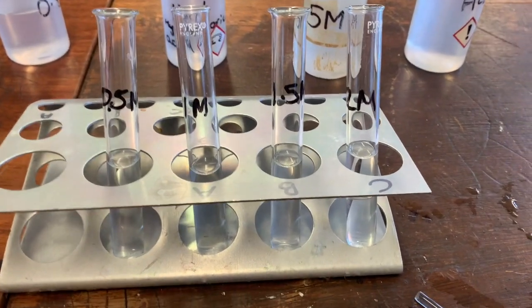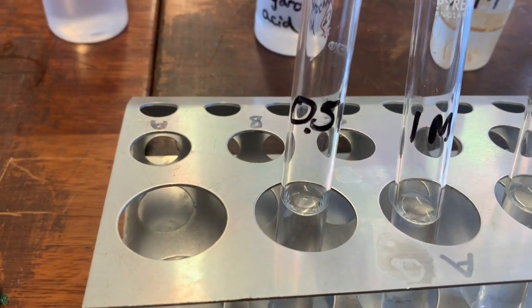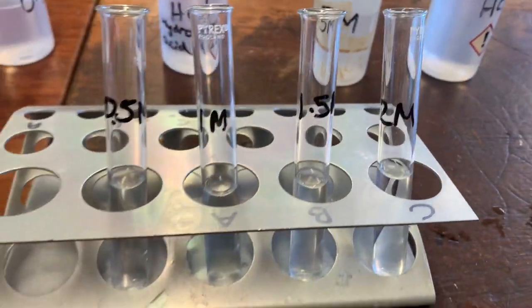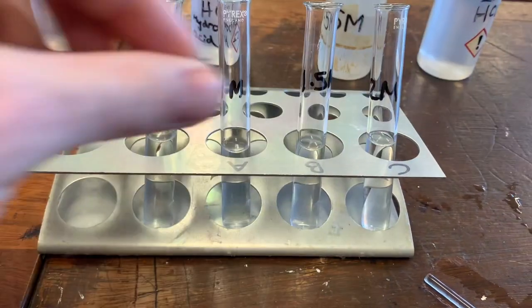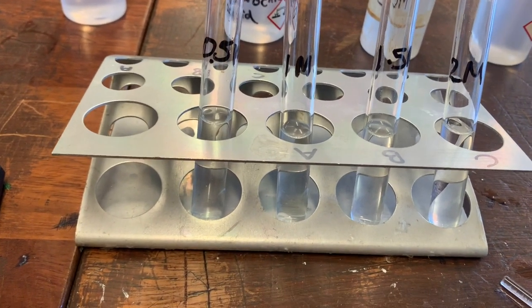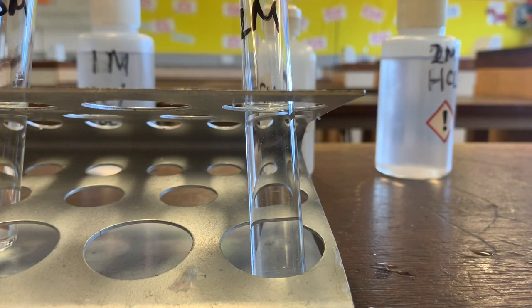We'll look at how that affects the speed at which magnesium reacts with the acid. We're going to do it exactly the same way we did last time, with the same volumes of hydrochloric acid in each one, just changing the concentration from 0.5 to 1, to 1.5 to 2. We're going to take a small piece of magnesium and place it in each of these different test tubes. Let's have a look at how that works with the 2 molar first. Here's my 2 molar solution — I've got my timer ready to go, so let's put this in.